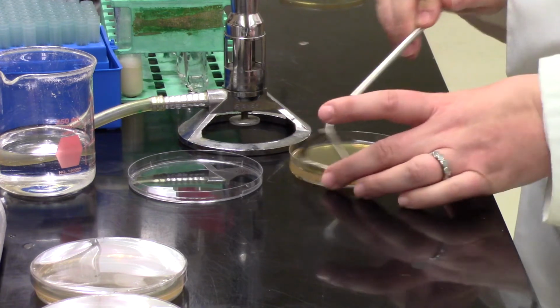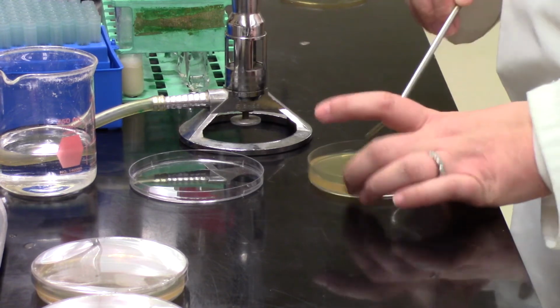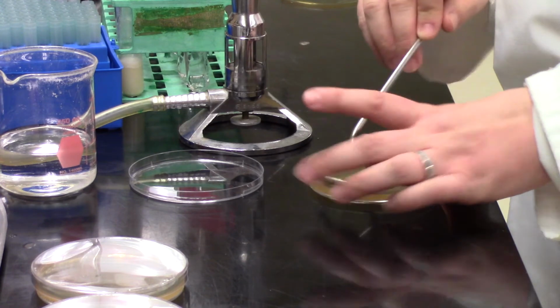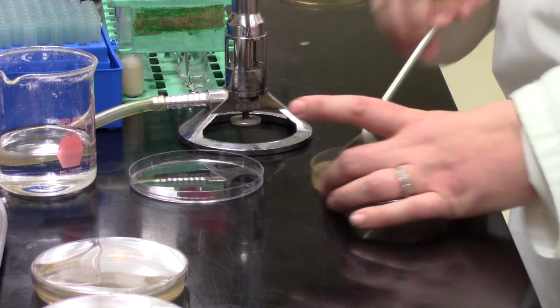And like I said, you'll have lots of chance to practice it in the lab, and then we will continue doing some spread plating and some dilutions of some probiotics, and we'll give you a big data set to play around with to compare some of these different products.